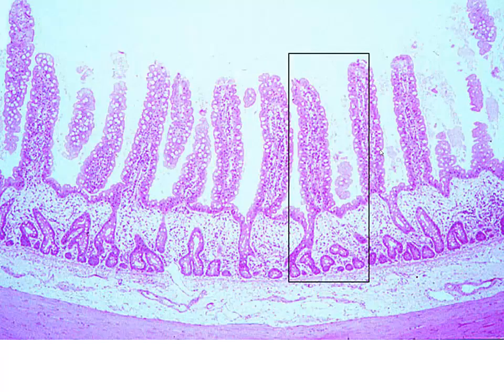Here at higher magnification of the villi, you can see the number of white spots that we see on the sides of the villi. Those are our goblet cells, and see how slender these are. Much more thin than we saw in either the jejunum or in the ileum. You're still going to have the same components. There will be lacteals in the center of these, not quite as prominent. We'll see those crypts of Lieberkühn with our lamina propria, submucosa, and muscularis externa.